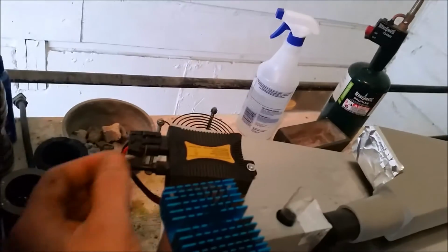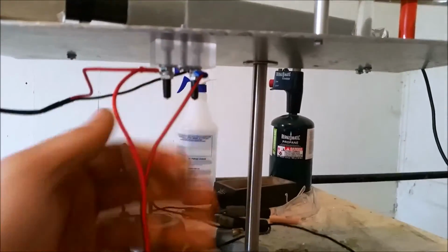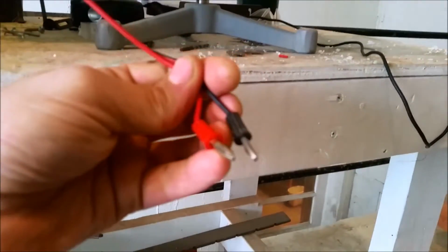But here I have the light ballast hooked up to a power block, and this runs to my bench top, and then the camera plugs in via USB here.